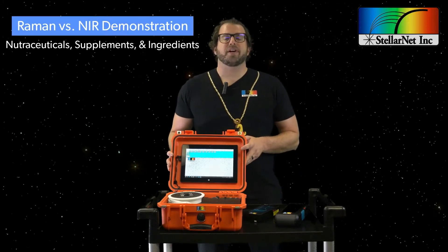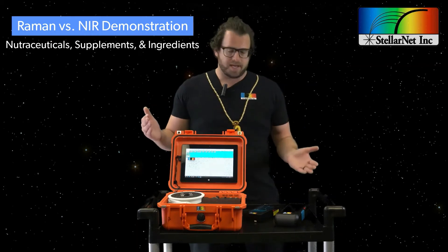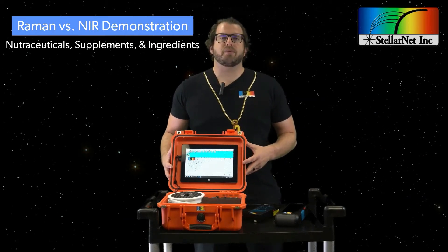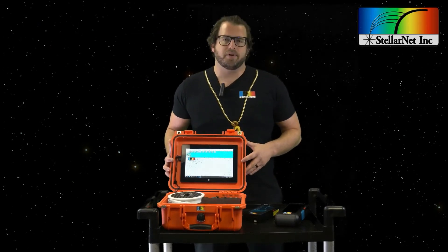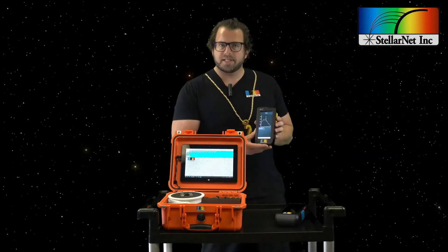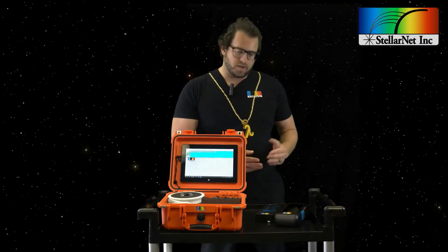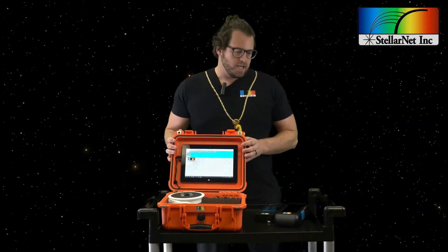I'm going to do a quick example of a common application where both Raman and near-infrared spectroscopy will work — a nutraceutical application. There are a variety of nutraceuticals made of organic substances and ground leaves that aren't necessarily pure extracts. Those may cause fluorescence and might not be ideal for the 785 nanometer Raman. Here's a quick demo of some nutraceuticals that work with the 785, and some that don't — showing that the near-infrared system and the 1064 nanometer Raman work in both cases.